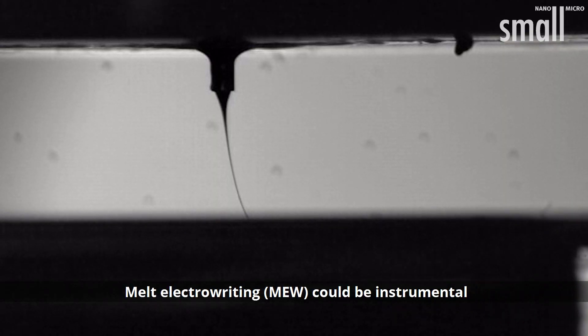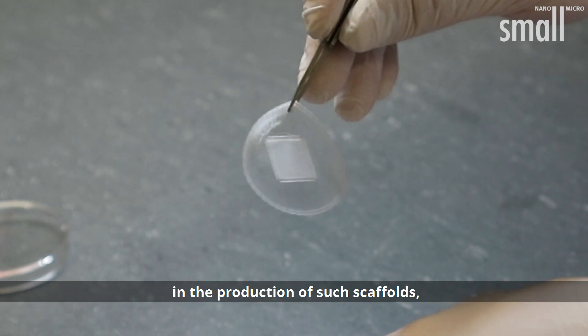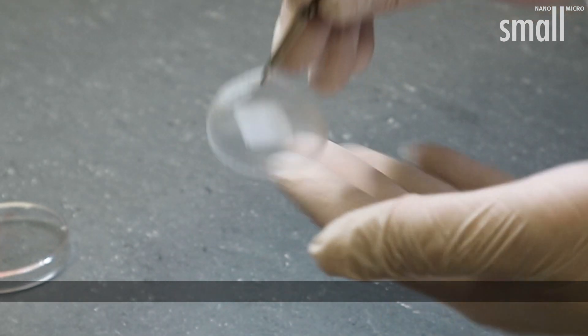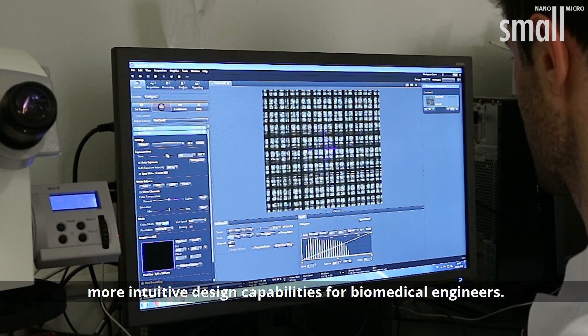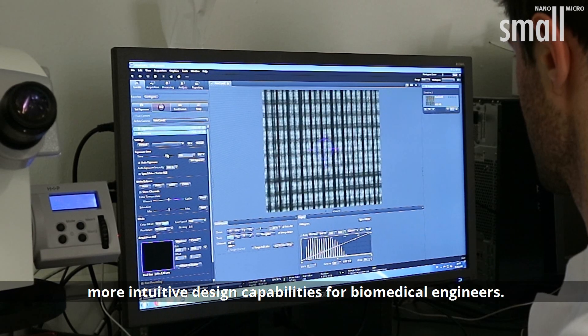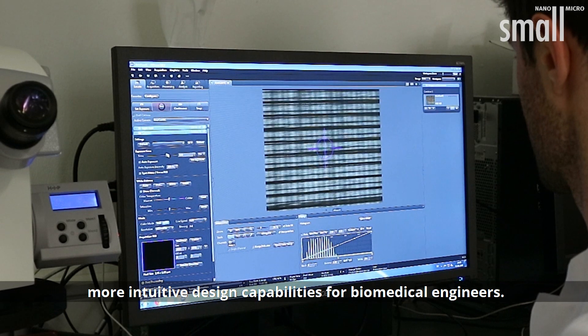Melt-electro writing, or MEW, could be instrumental in the production of such scaffolds. However, this technology requires more intuitive design capabilities for biomedical engineers.